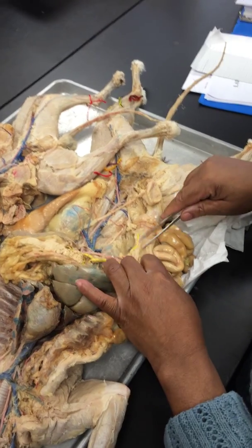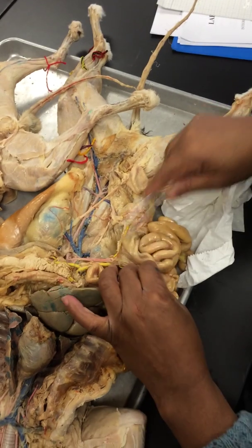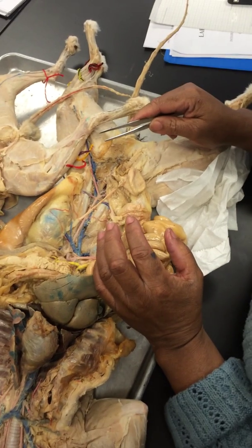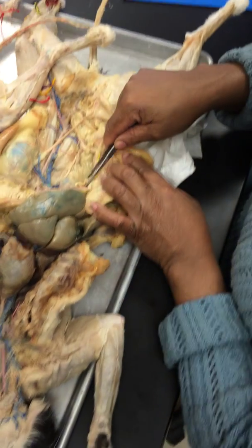That's right there. So let's do them and get them out of the way. Remember now, the hepatic portal serves the digestive structures and the other viscera within the abdominal cavity. Okay. And they're represented in yellow because they wanted us to see them.